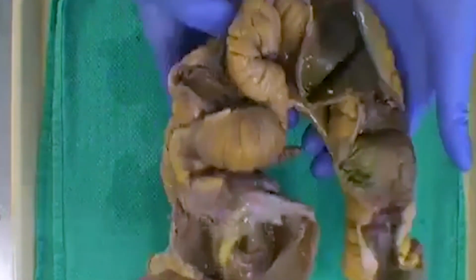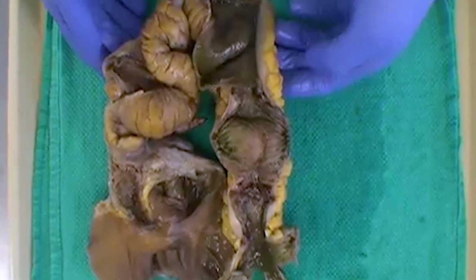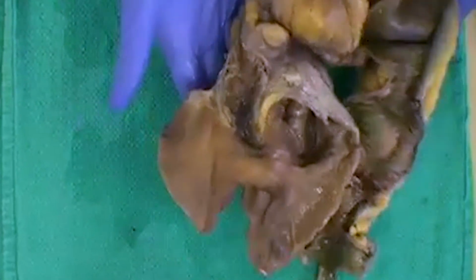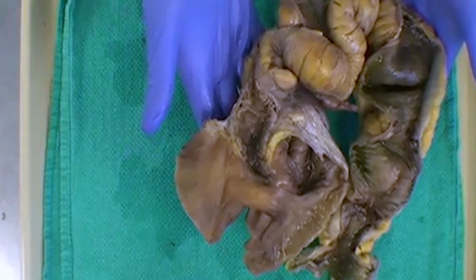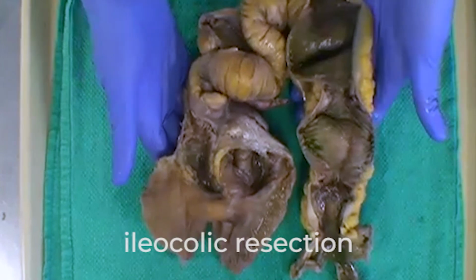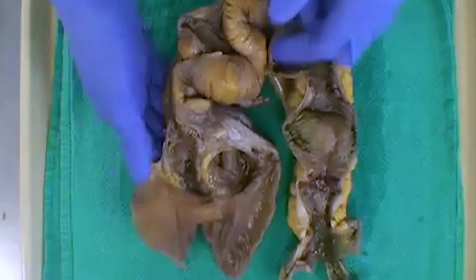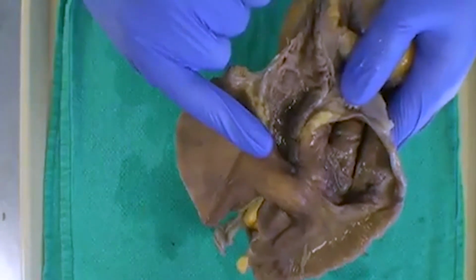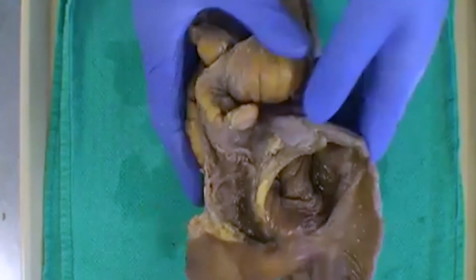Okay, so we have small bowel, perfect. Is there anything else? Okay, yeah, cecum, I see. So this is an ileocolic or ileocecal resection. We have our small bowel running here, and we have our IC valve right there. We have an opening to our cecum, our blinded pouch.